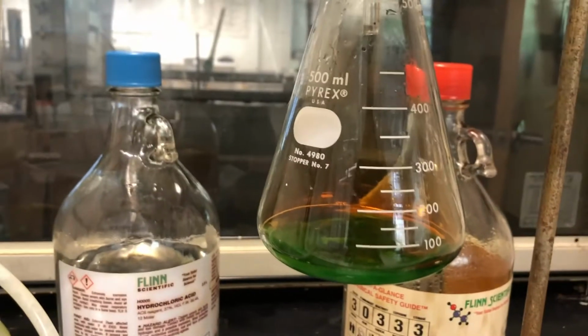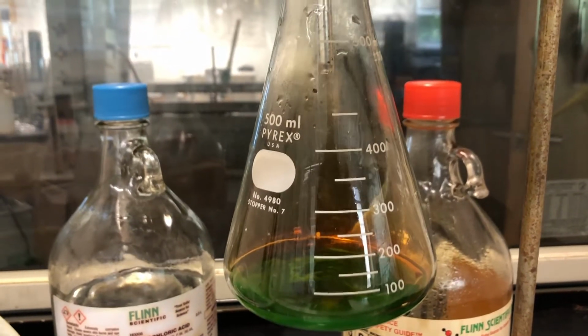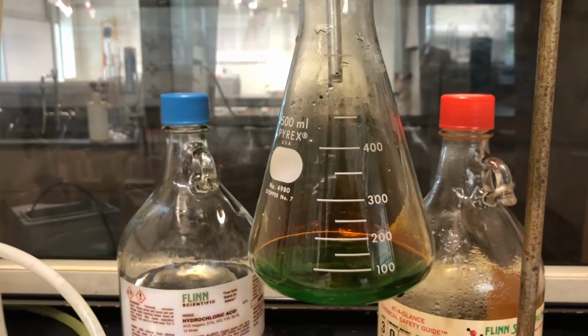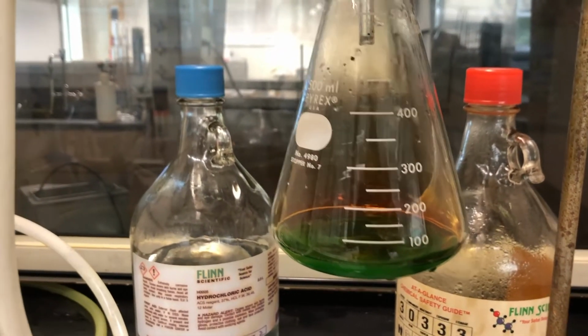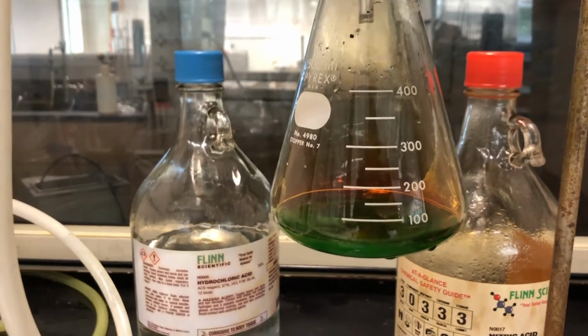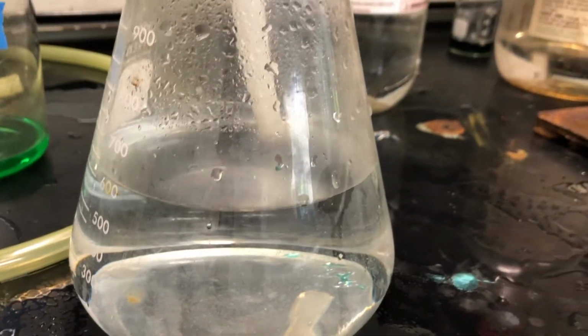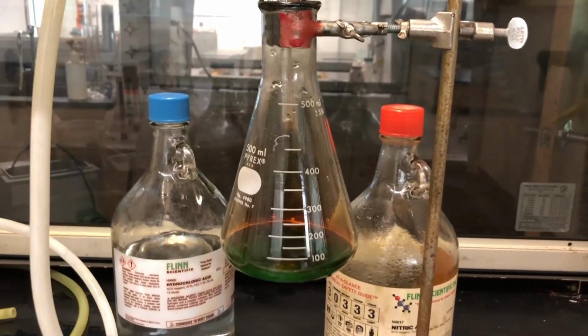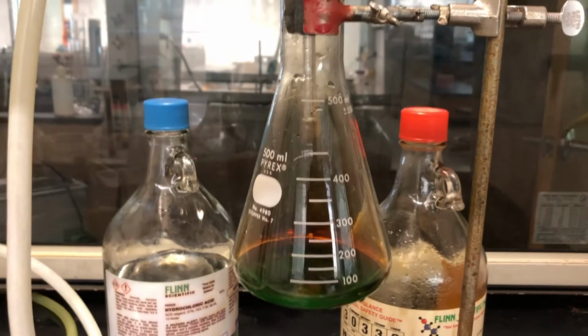Okay, so I'm going to let this go a little bit. A couple things are happening, and again, you're thinking about what do I feel like I definitely know, what do I feel like I maybe know, and what do I feel like I definitely don't know. So you can see here, you can zoom out, see some bubbles forming over there, right? So going back to here, you could probably figure out where those bubbles are coming from. That's something you should hopefully feel pretty confident in.